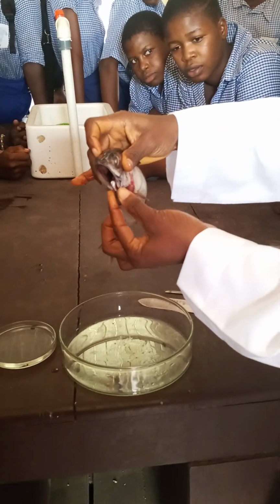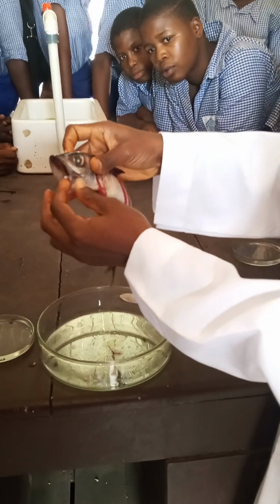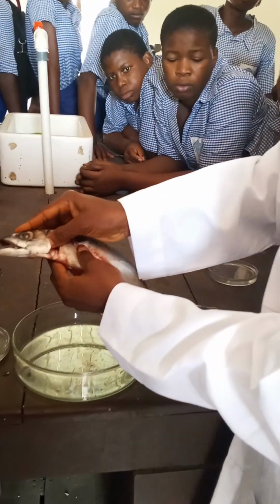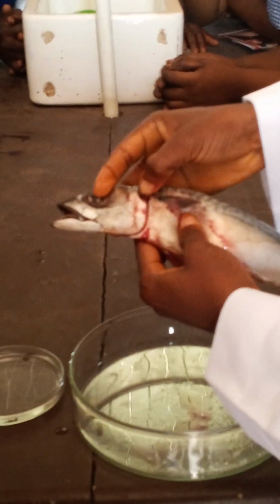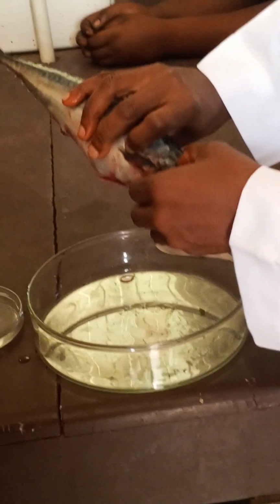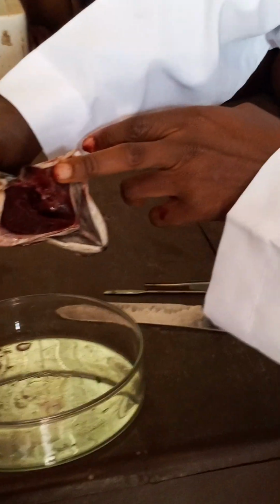Yes. It will take water from the habitat, and water runs into the mouth, and it will flow over the gills. Now, the gills are being protected by the operculum. This is the operculum, or you call it gill cover. Can you see the operculum? Yes. The operculum is paired and can be found on either side of the head. You find it here too, the operculum.